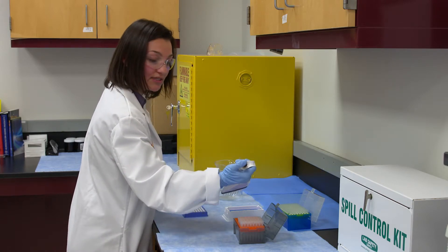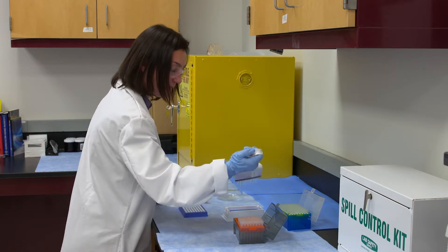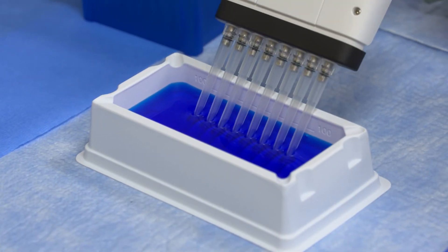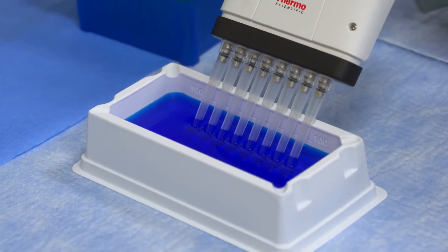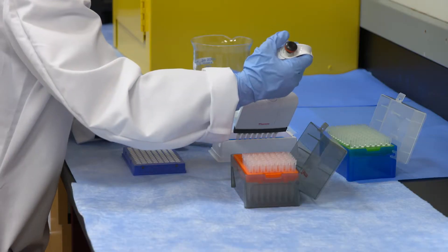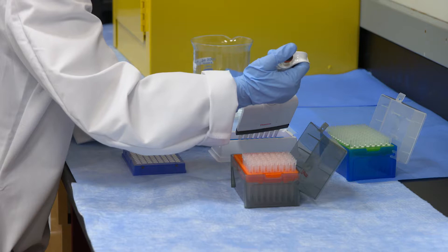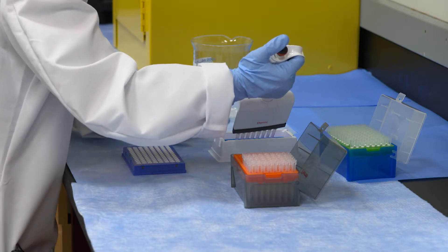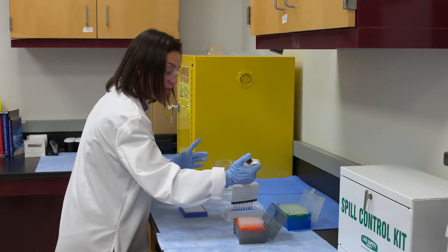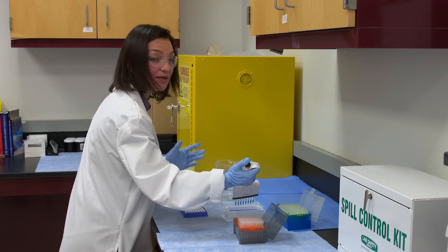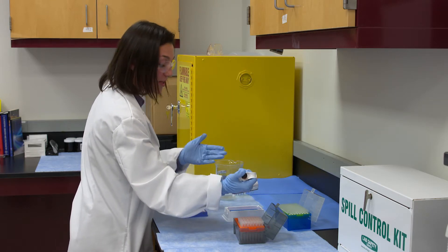Before you go into the solution you press the button and then you just submerge your tips in the liquid and you release slowly and you want to give it another second before you remove the tips from the solution to give it time for the air to catch up, otherwise you're going to have bubbles inside the tip and you're not going to have a uniform volume across.